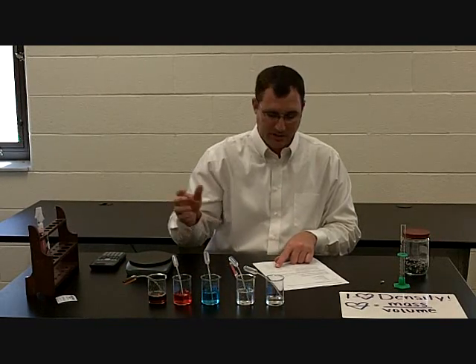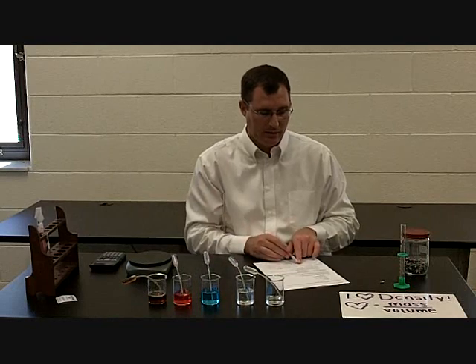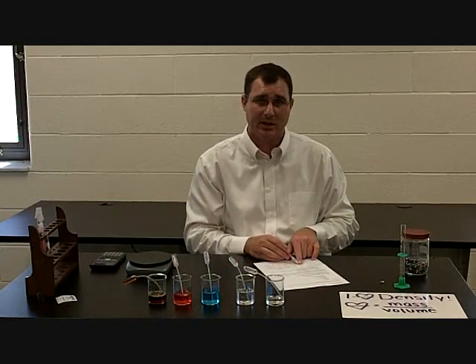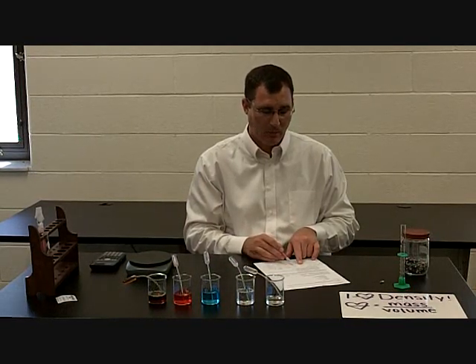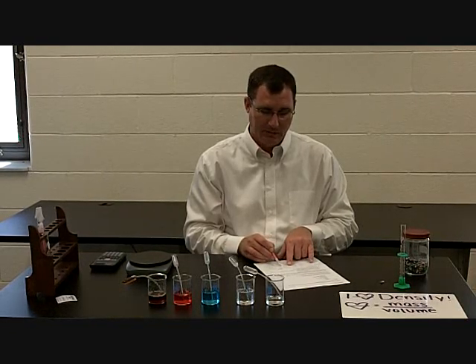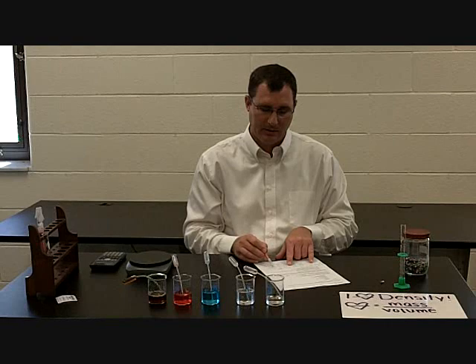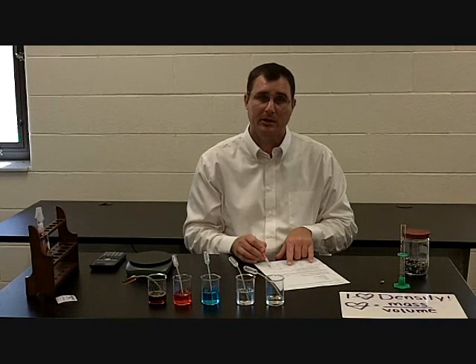The Windex — I do the same thing, weigh it, and it weighs 5.6 grams. I subtract 0.9 grams, which gives me 4.7 grams. Divided by 4.8 gives me 0.98 grams per milliliter.